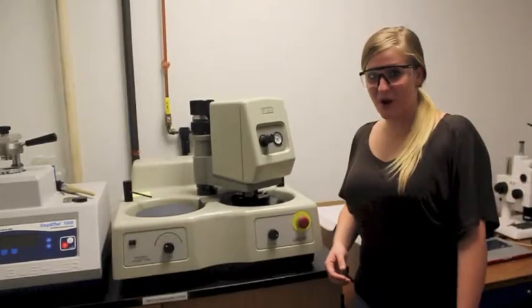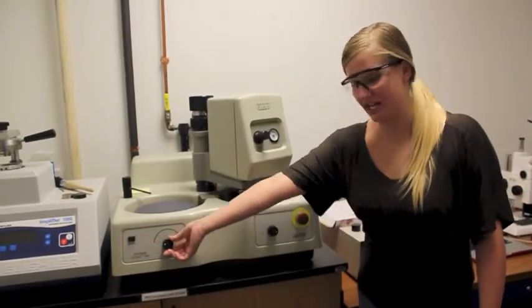The machine will stop automatically after the timer runs out, or you may stop it manually by turning the timer down.